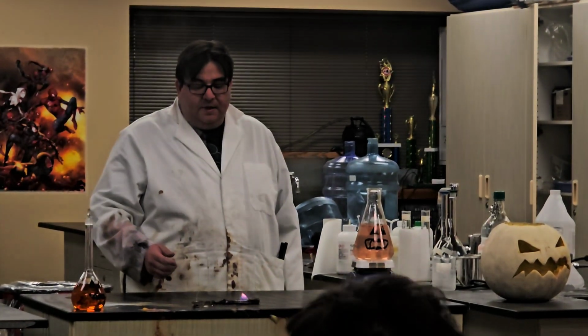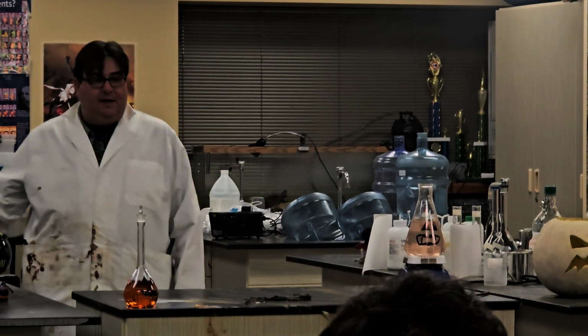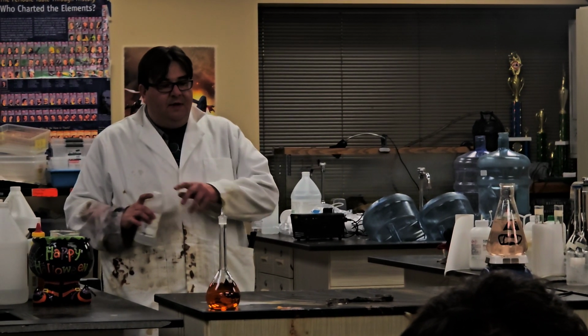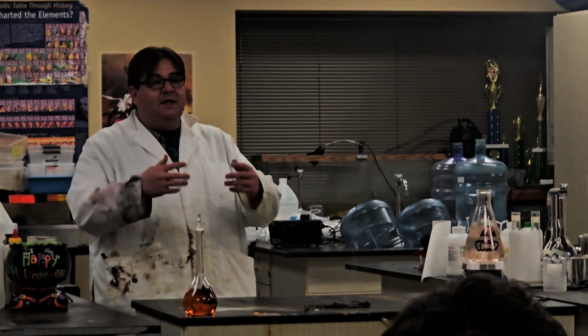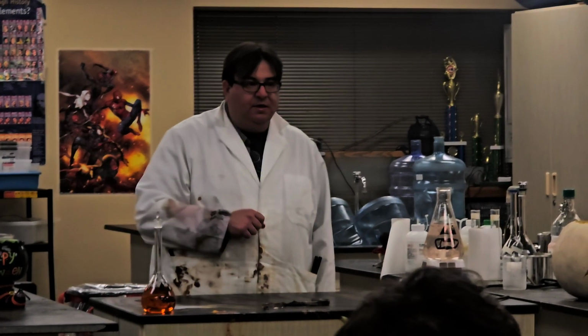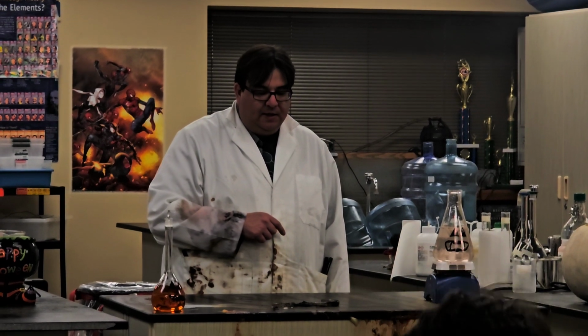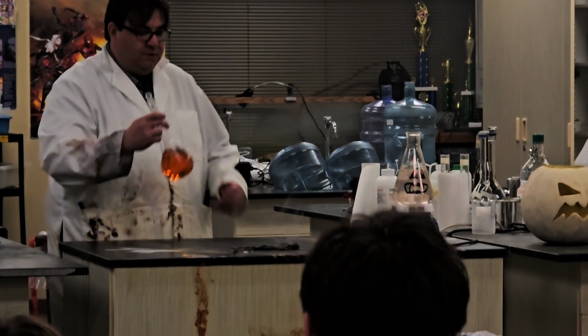That was an exothermic reaction. The things that are mixed together are glycerin, a carbon oily substance, with potassium permanganate, which is a very strong oxidizer. By mixing a strong oxidizer with a carbon-containing compound, it was able to start a reaction which basically turned all the glycerin into charcoal. So I just have a little mixture of charcoal here.